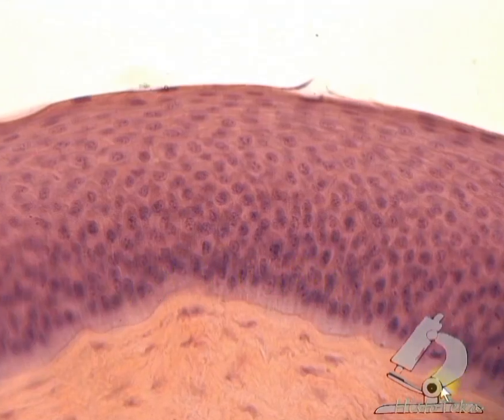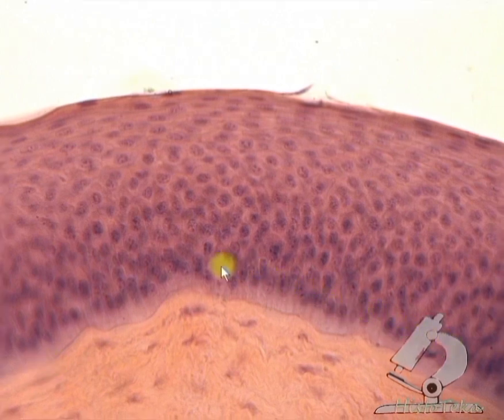By the way, in the corneal epithelium, the basement membrane reaches 1 micron and is visible at the light optical level. That means on the preparation. This is the basement membrane. Further, on the basement membrane are the cells of the basal layer. Some of these cells are stem cells, others have already entered the path of differentiation. The nuclei of these cells are oval and located perpendicular to the basement membrane.